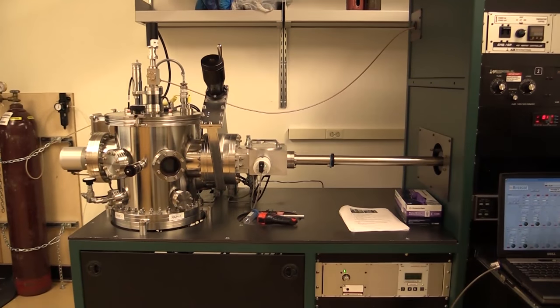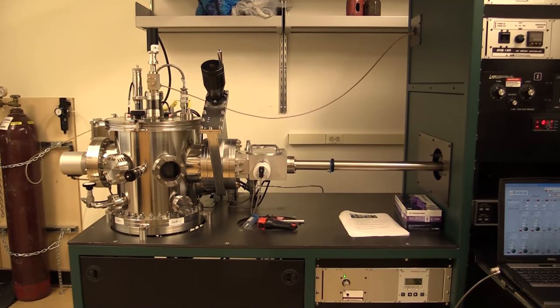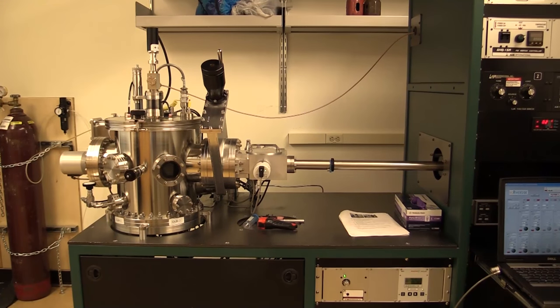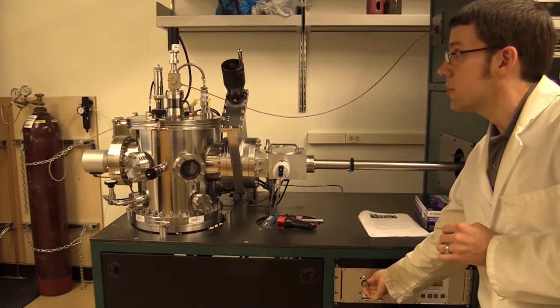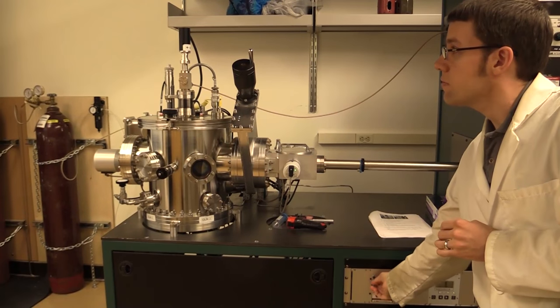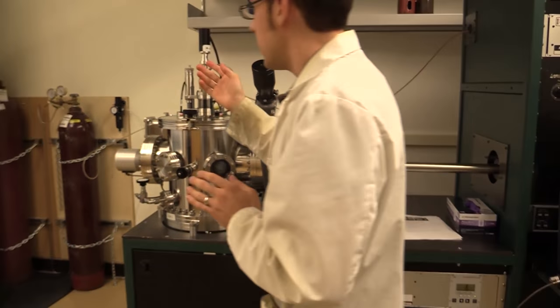We'll turn off the load lock by flipping the switch to open the load lock circuit. Then the process is complete. We've got our sample back in our load lock chamber. The final steps are to close our valves on our argon and nitrogen tanks, and turn off substrate rotation as well.